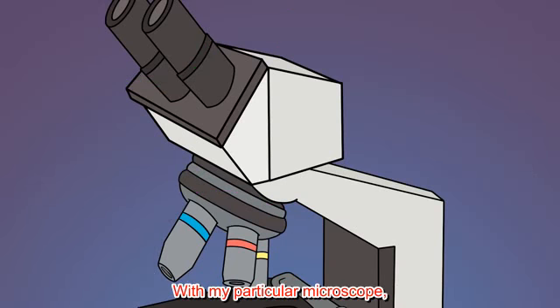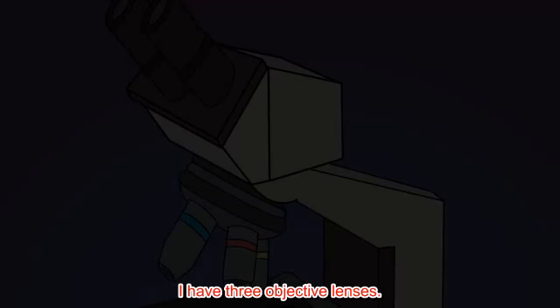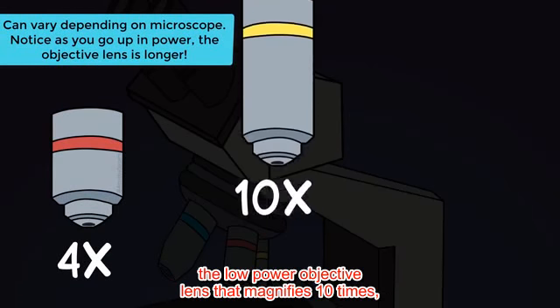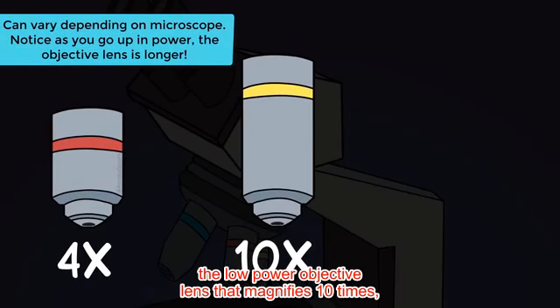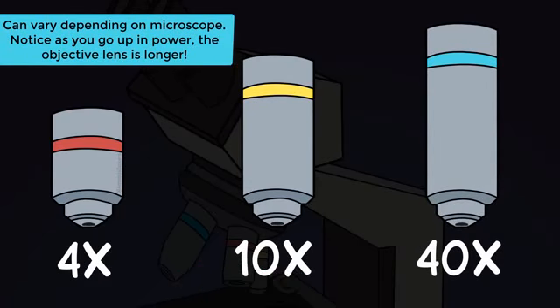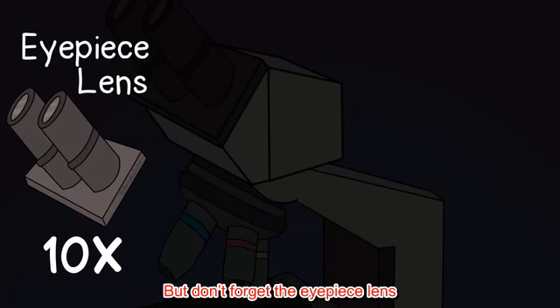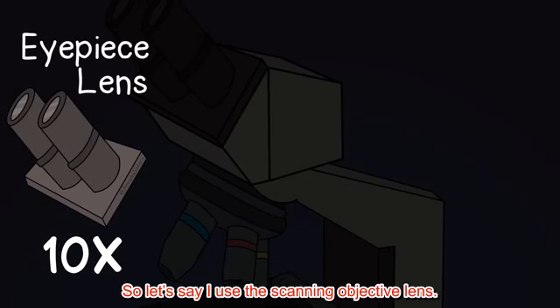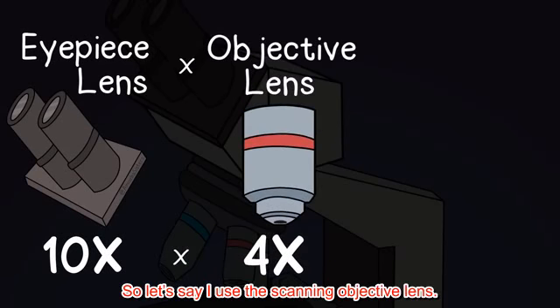With my particular microscope, I have 3 objective lenses. A scanning objective lens that magnifies 4 times, the low-power objective lens that magnifies 10 times, and the high-power objective lens which magnifies 40 times. But don't forget the eyepiece lens, because that also magnifies images, and my particular eyepiece lens magnifies 10 times. So let's say I used the scanning objective lens.